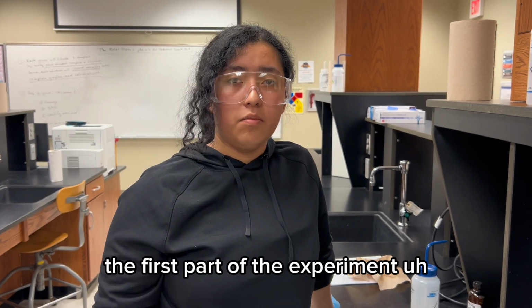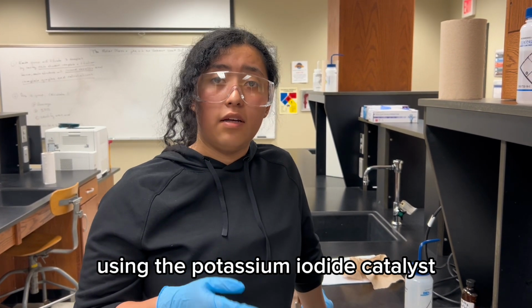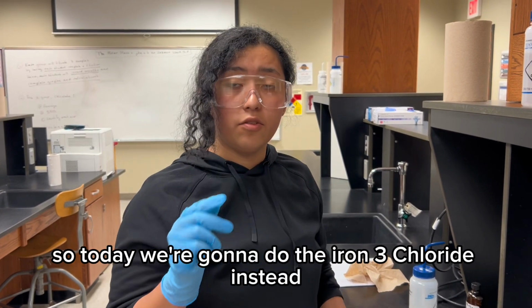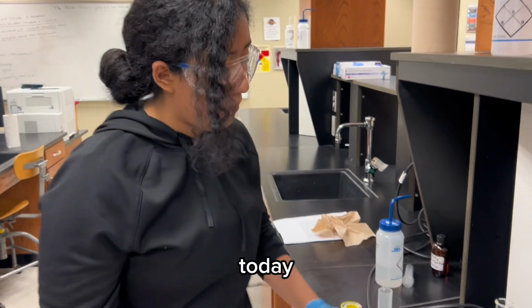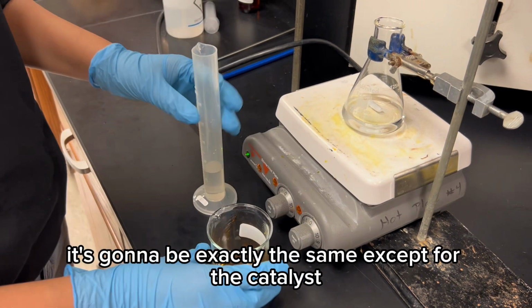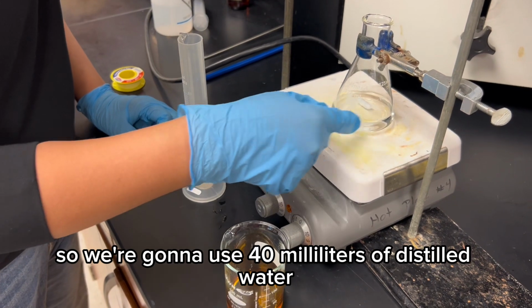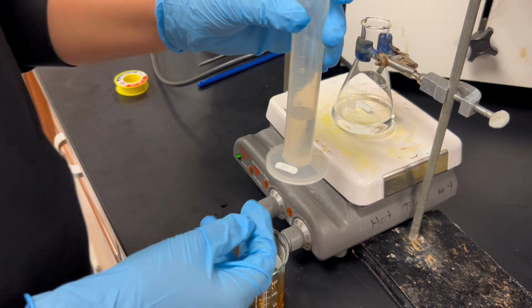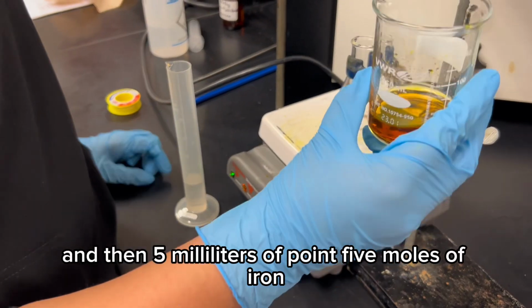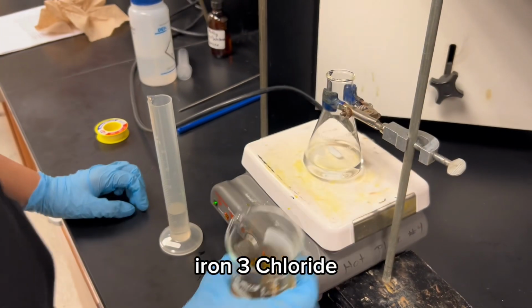The first part of the experiment involves the decomposition of hydrogen peroxide using the potassium iodide catalyst. So today we're going to do the iron chloride instead. As I said before, it's going to be exactly the same except for the catalyst. So we're going to use 40 milliliters of distilled water, 15 milliliters of 3% H2O2, and then 5 milliliters of 0.5 molar iron 3 chloride.